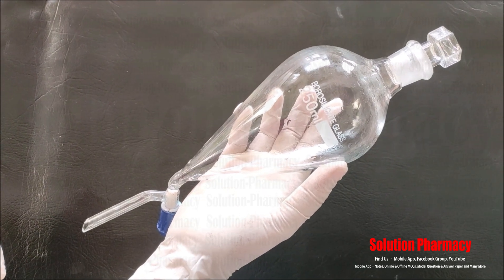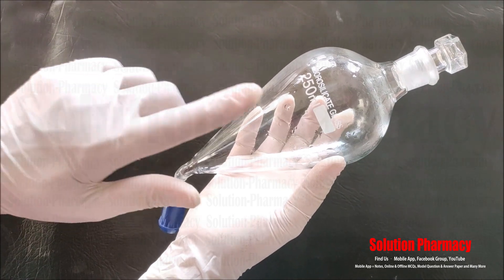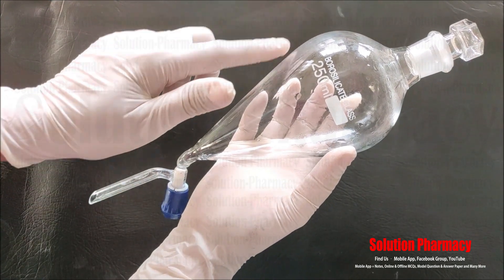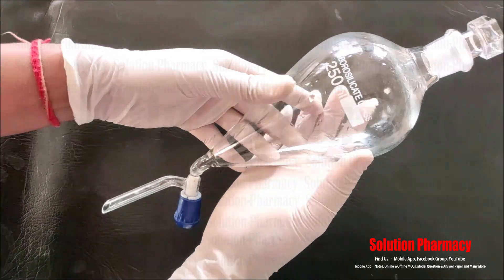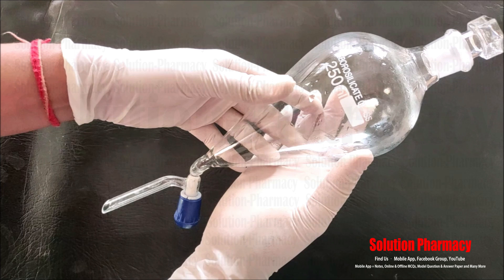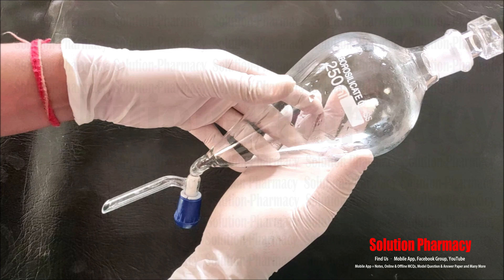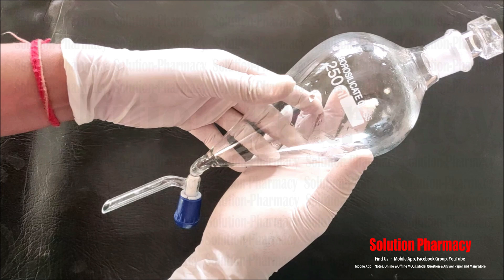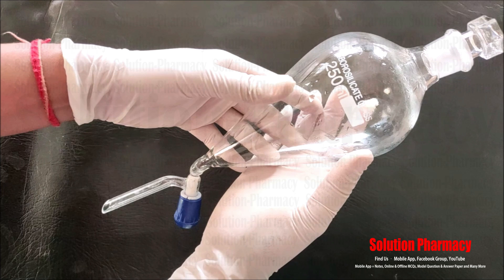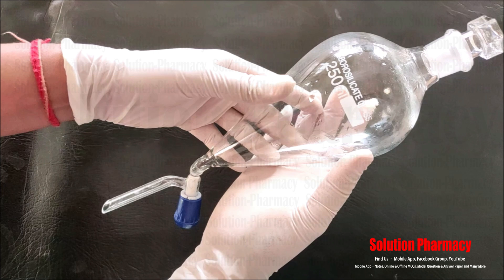This glassware is called a separating funnel because it is used to separate the layers of two immiscible liquids. This separating funnel is 250 ml, made of borosilicate glass, and is conical in shape with a pointed end. It is generally used for the liquid-liquid extraction method — partitioning a substance between two immiscible liquids. Immiscible liquids are liquids which do not mix with each other, remaining separated as two layers.